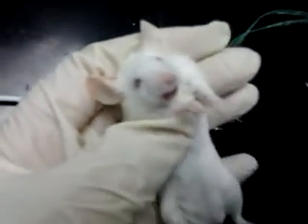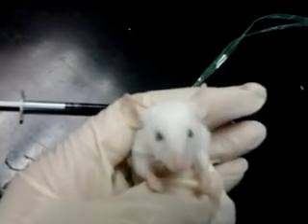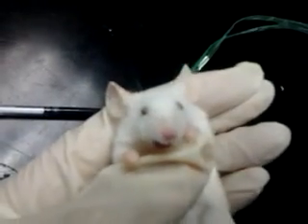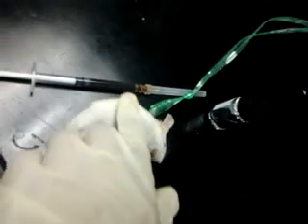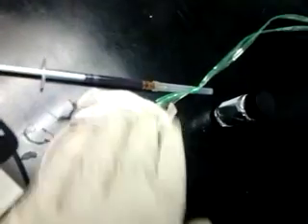Alright, so this is only for the mouse. We have subcutaneous, intramuscular, IP and intravenous. There are four routes, isn't it? Then the other route is oral gavage. But with oral gavage, the drug can break down in your gut and then in the liver before you absorb. So the dose you give is much higher than IV, much higher than IM, and almost equivalent to IP but with slightly higher volume and concentration. Just a different method.